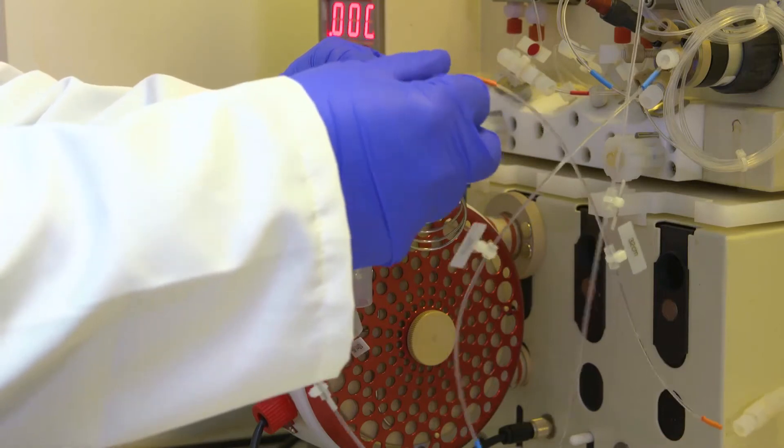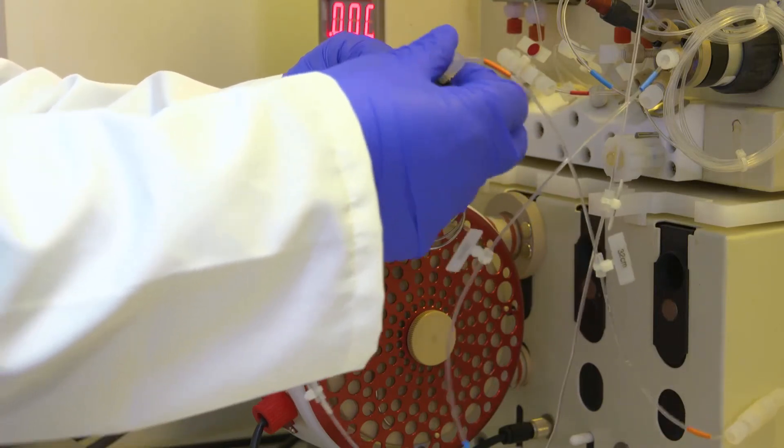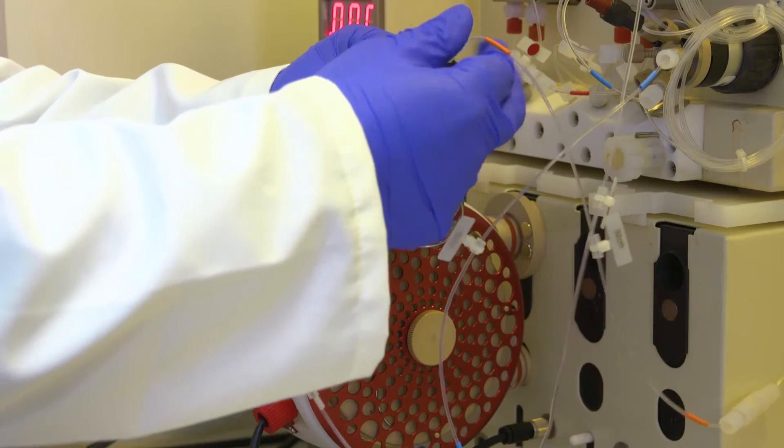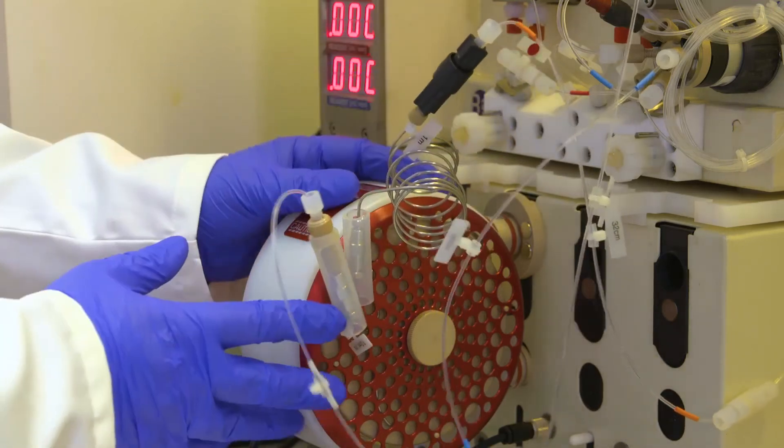For this experiment I'm using a 250 psi back pressure regulator because I'm going to be running at 250 degrees and I don't want my solvent to boil.